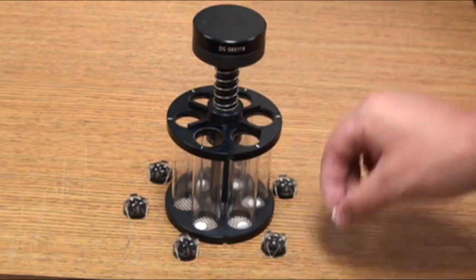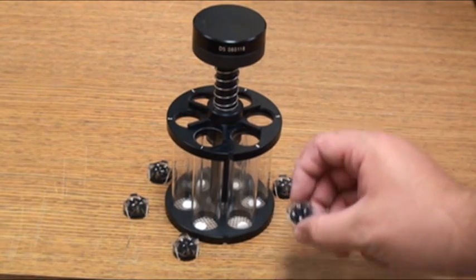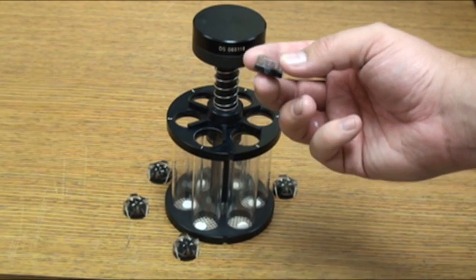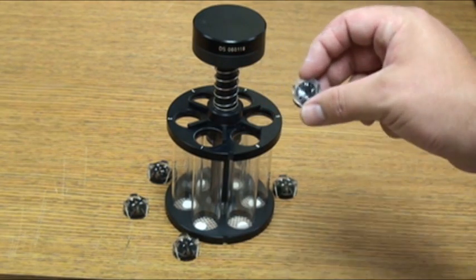Preparing for a test is no more complicated than any other disintegration tester. Simply drop the tablets in. Each disc is numbered that corresponds with a chamber.